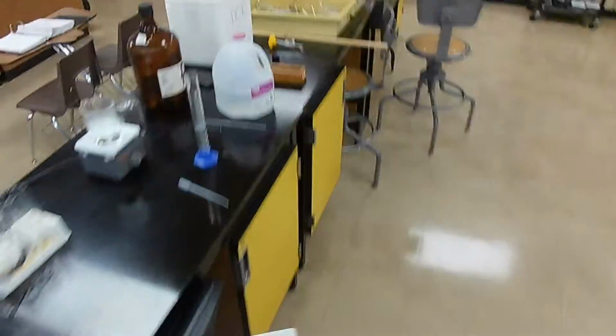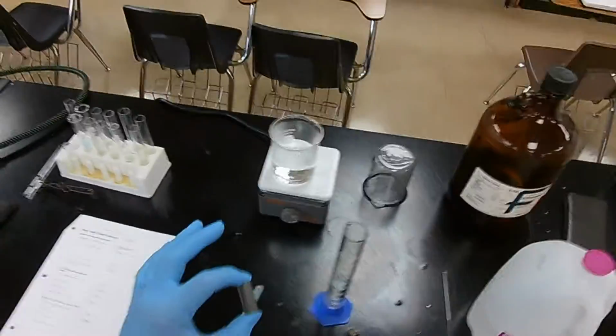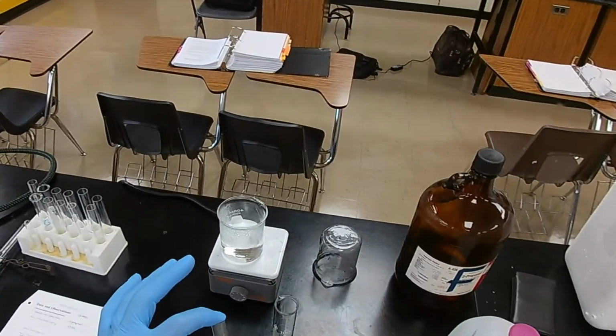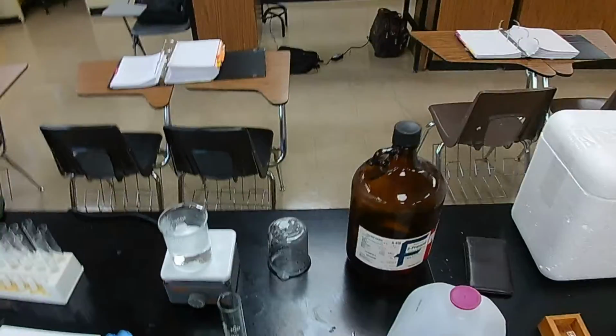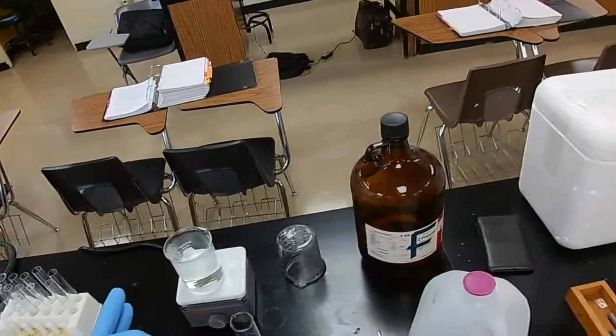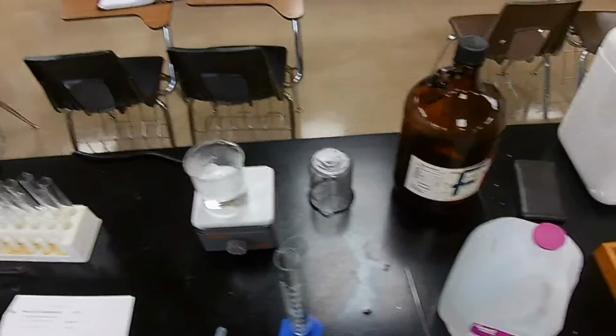If you try to do this by difference with something that's less dense than water, then simply putting it in the water is not going to work, because only part of it will be submerged. And that's the part that displaces the water. So you have to modify your procedure, and we don't have to go into it right now.